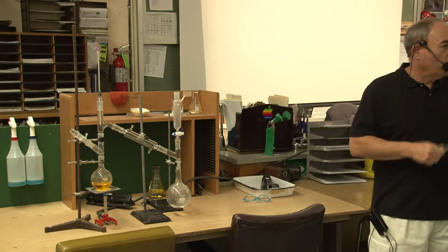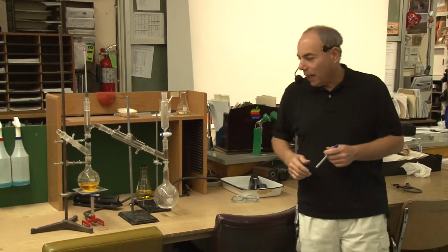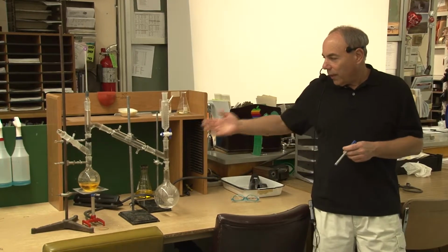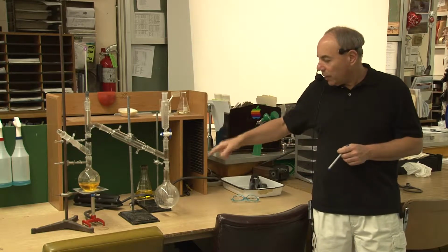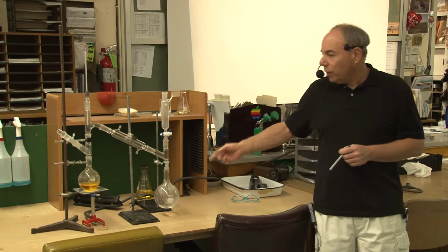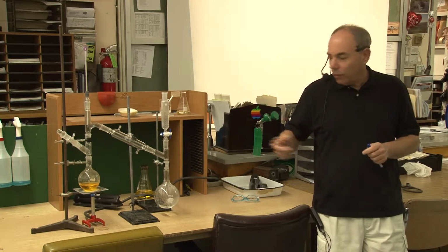Okay, now if you want to, you can actually do this a couple times and actually purify the liquid even more. They have a setup like this under vacuum. Now you guys haven't learned about this yet, but you can actually boil substances if you put everything under vacuum. And this is actually a setup where you can pull a vacuum right out of here, okay? And the vacuum basically will allow you to boil it without having to heat it. You can boil it at room temperature, okay?